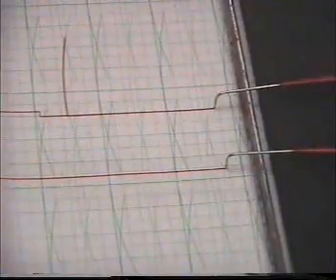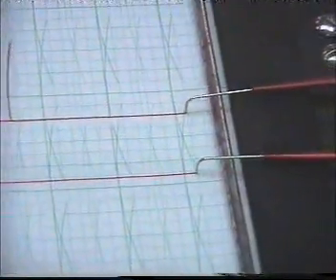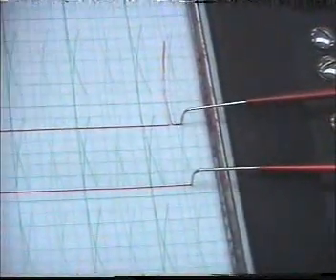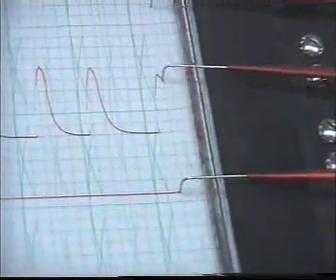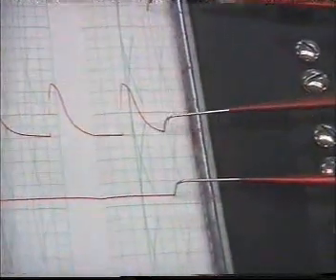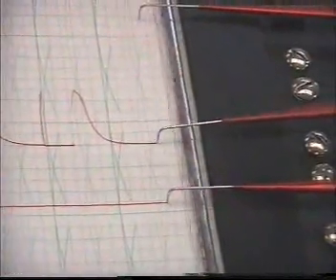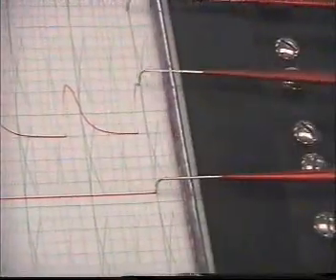The effect of exercise on muscle contraction. When we start stimulating the muscle, at the beginning the muscle is active. The contraction. Then, as we increase with exercise, it goes down, and the contraction cycle will become prolonged as a result of fatigue.